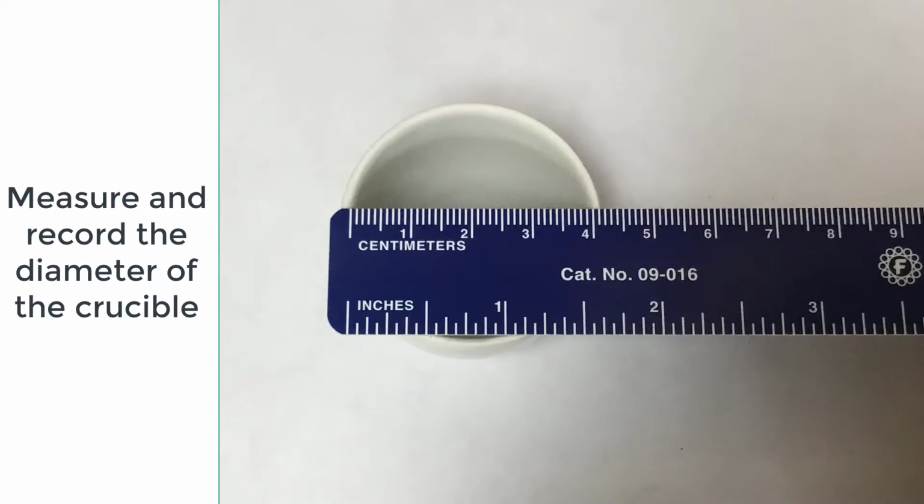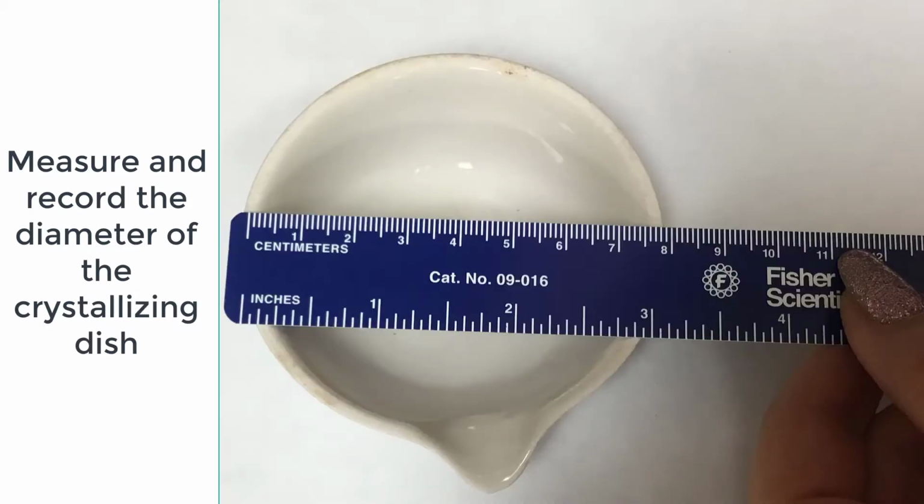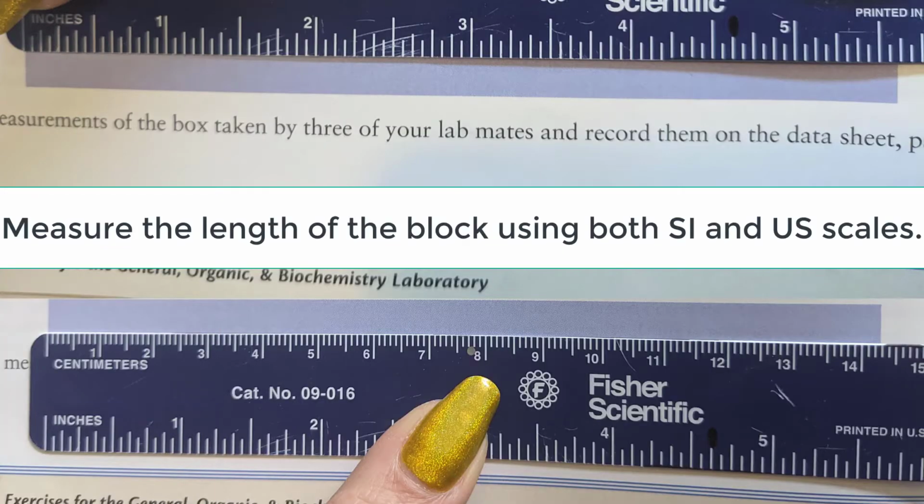Use the ruler to measure the diameter of the crucible. Record the measurement. Use the ruler to measure the diameter of the crucible cover. Record the measurement. Use the ruler to measure the diameter of the crystallizing dish. Use the ruler to measure the length of the box.